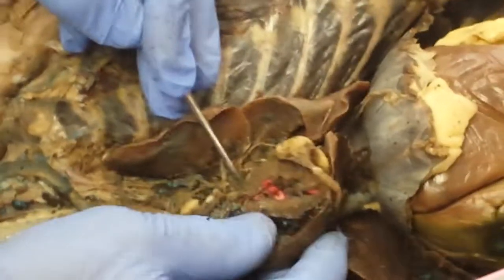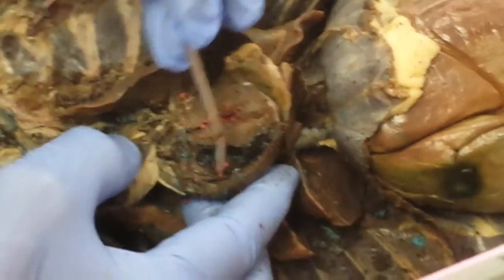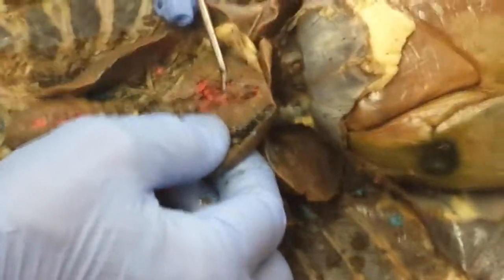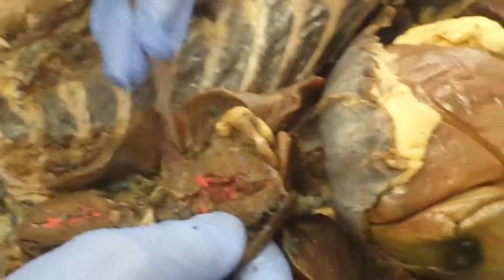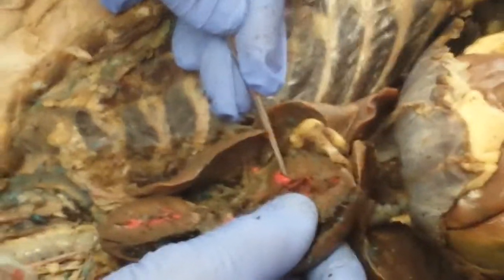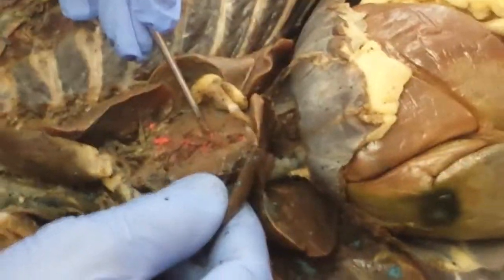From the left atrium, blood passes into the left ventricle here. This structure right here is the interventricular septum. It's easy to identify right and left ventricles when the heart is cut. Why? Right ventricle is about 1/3 the thickness of the left ventricle. You also can appreciate here a papillary muscle, chordae tendineae, and blood passing from the left atrium to the left ventricle travels over what valve? The tricuspid. No. Bicuspid. Mitral valve. I'm calling out all the wrong answers. Alright, so once in the left ventricle, then blood does what?